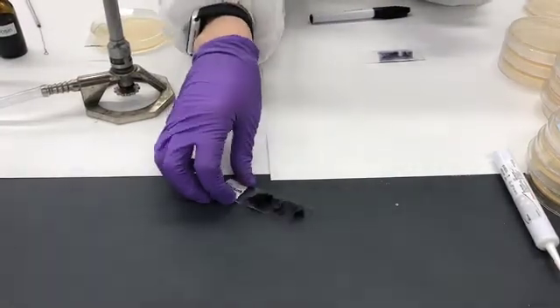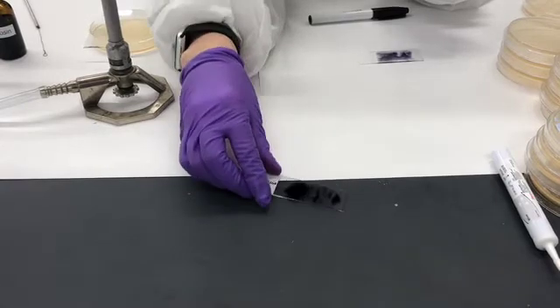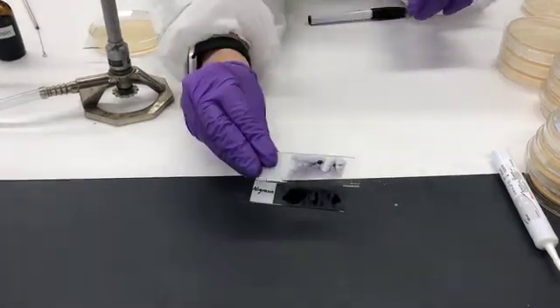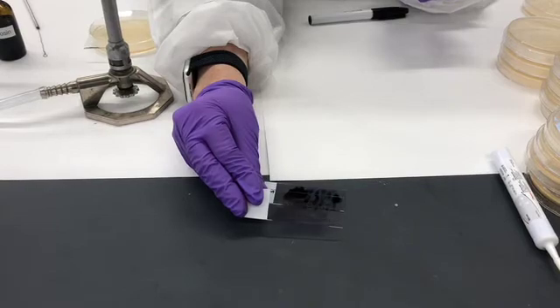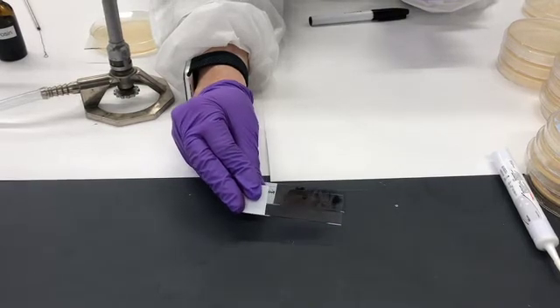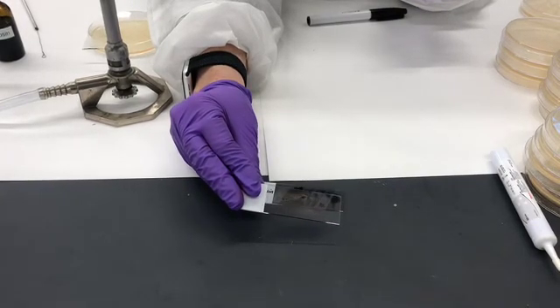Allow this to dry over time. Once it's dry, it might look something like this. No cover slip — you can simply begin to observe this under the microscope.